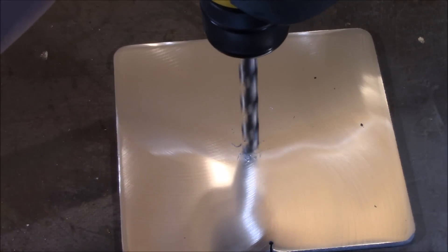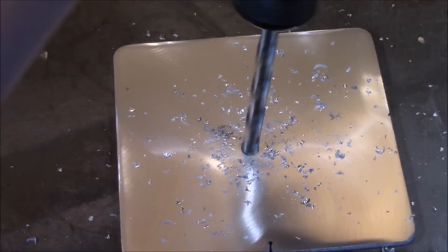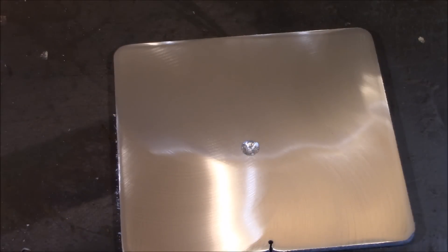So to help this reaction happen, I took my 400 grit sandpaper placed on my hook and loop pad and sanded off the oxide layer. Then took a drill bit and made a nice little bowl to hold the mercury in.